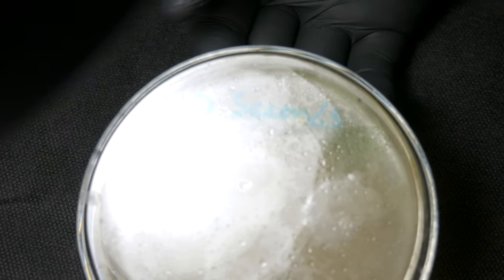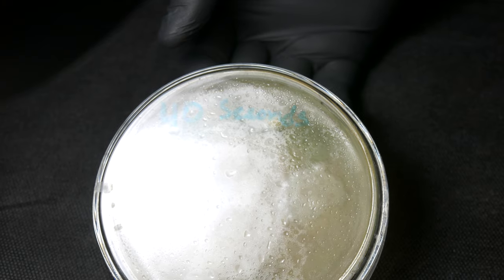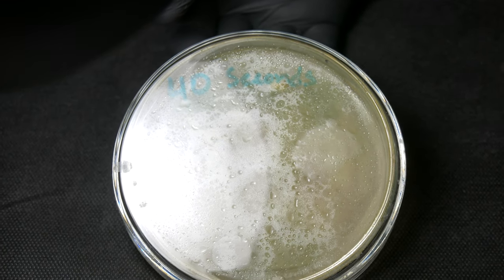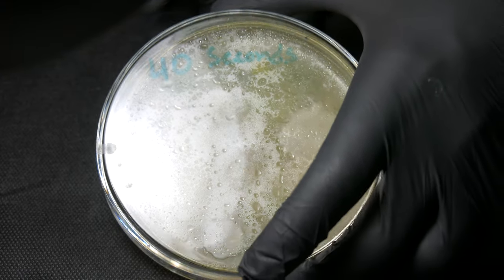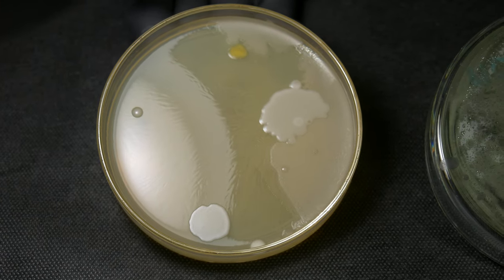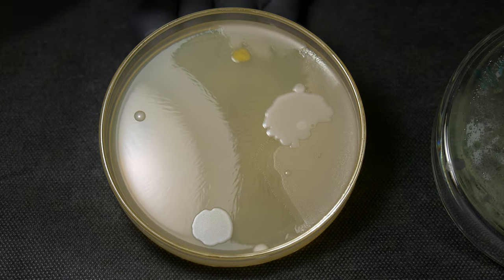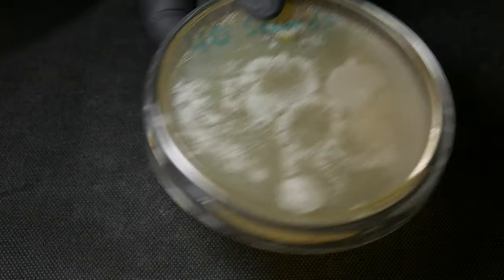Onto the plate after boiling the pond water for 40 seconds — again around 100 microliters were put on each plate. I think this plate is the best example for how many different colony morphologies can be noted. You see a bunch of different colony morphologies: dark yellow, white, and more opaque white. That opaque white could potentially be fungi, which I think is the most interesting.